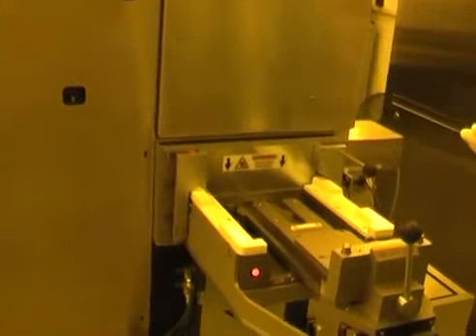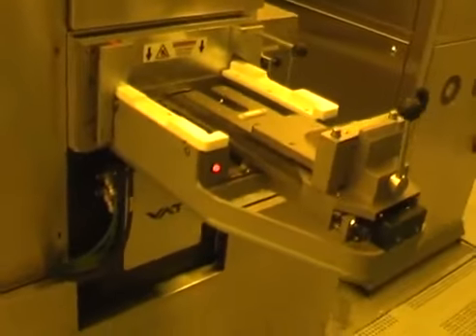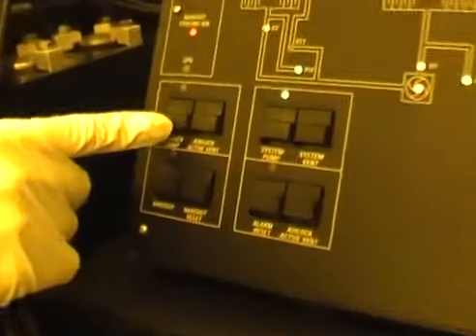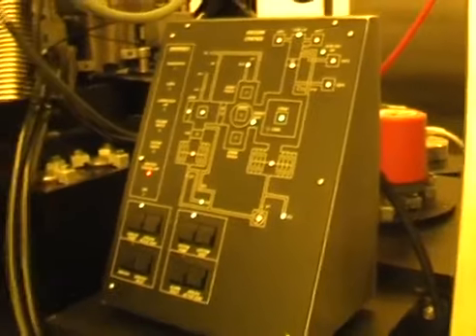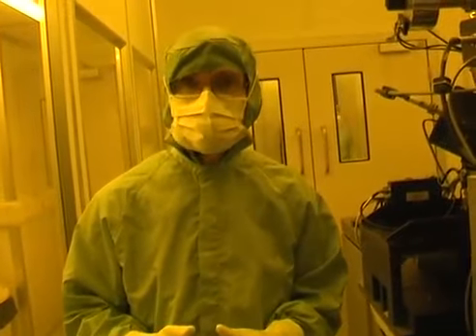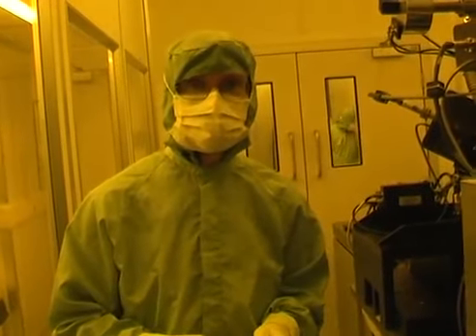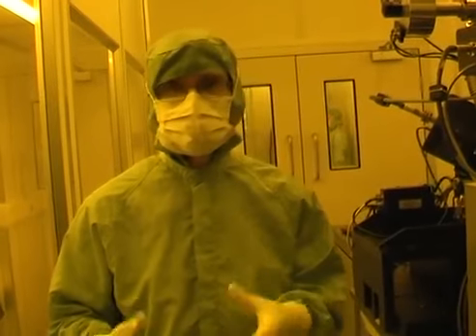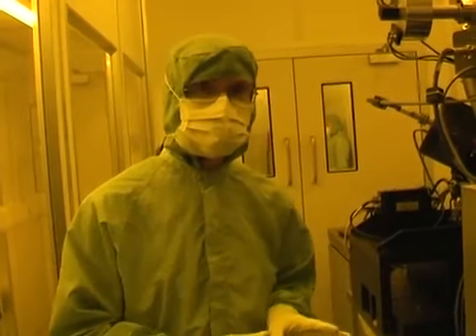So now the sample is on its holder, it's loaded into the airlock, and all I need to do is come round here and press airlock pump. It pumps out the airlock. And the airlock will now take about 20 minutes to pump out, after which point we can start to set up the job. Normally speaking, the operator would load 10, 15, 20 jobs before pumping everything down.